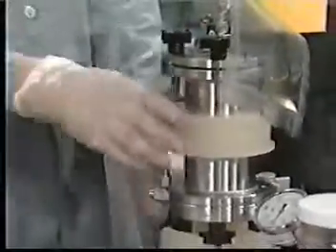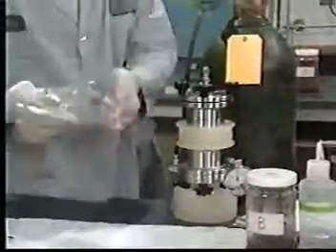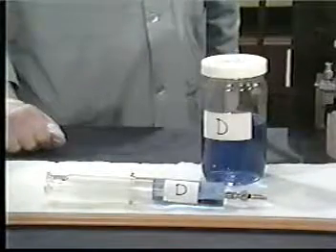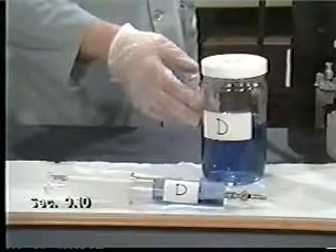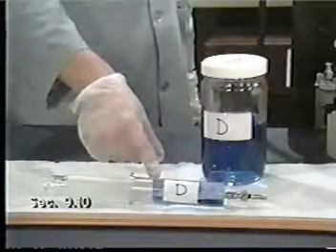Close the valves and discontinue pressure. Disconnect the filtrate collection container. The initial filtrate is to be handled as follows. If the original waste, like our example D, is less than 0.5% solids, the filtrate equals the TCLP extract and is ready to be aliquoted for analysis.